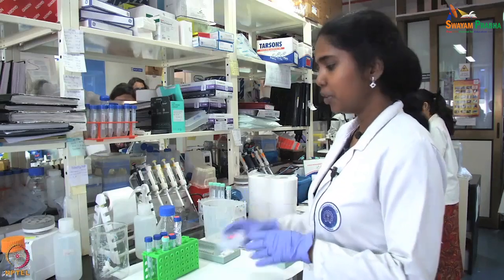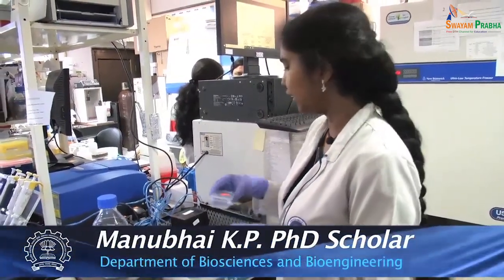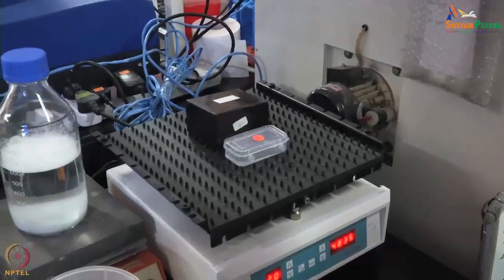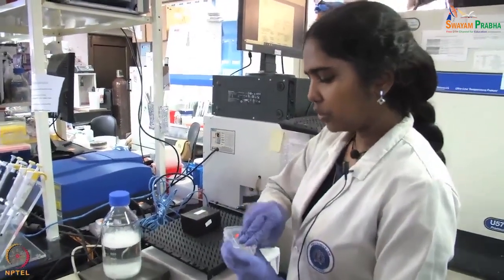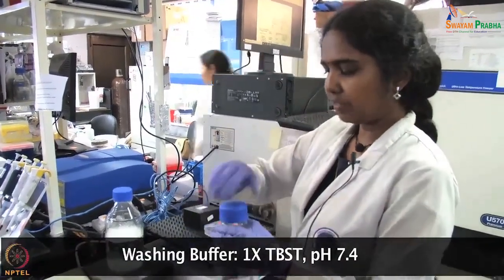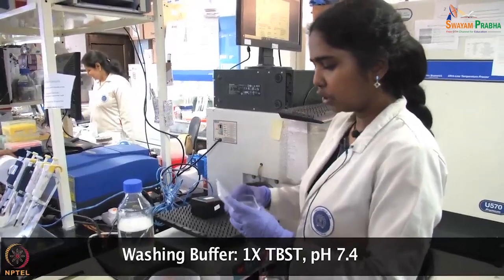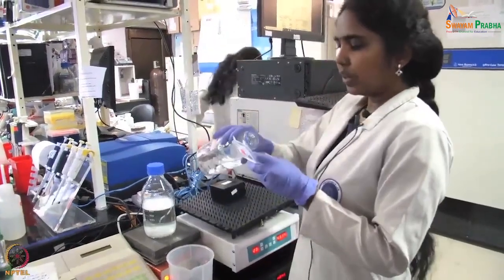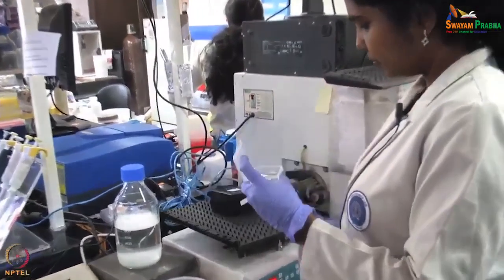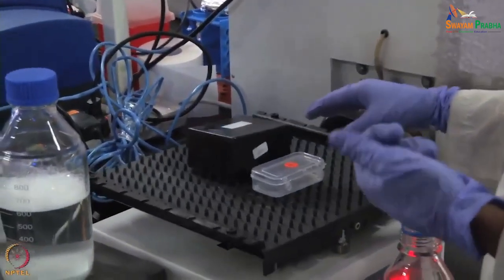Now I will be showing how to do autoantibody screening using Huprot arrays. After adding blocking solution, you have to keep it for 2-hour incubation at room temperature with gentle shaking on a rocker. After 2-hour incubation, you wash the solution using 1x TBST at pH 7.4. First discard the blocking solution, add 1x TBST, keep it on the rocker, and repeat this step 4 times for 5 minutes each.